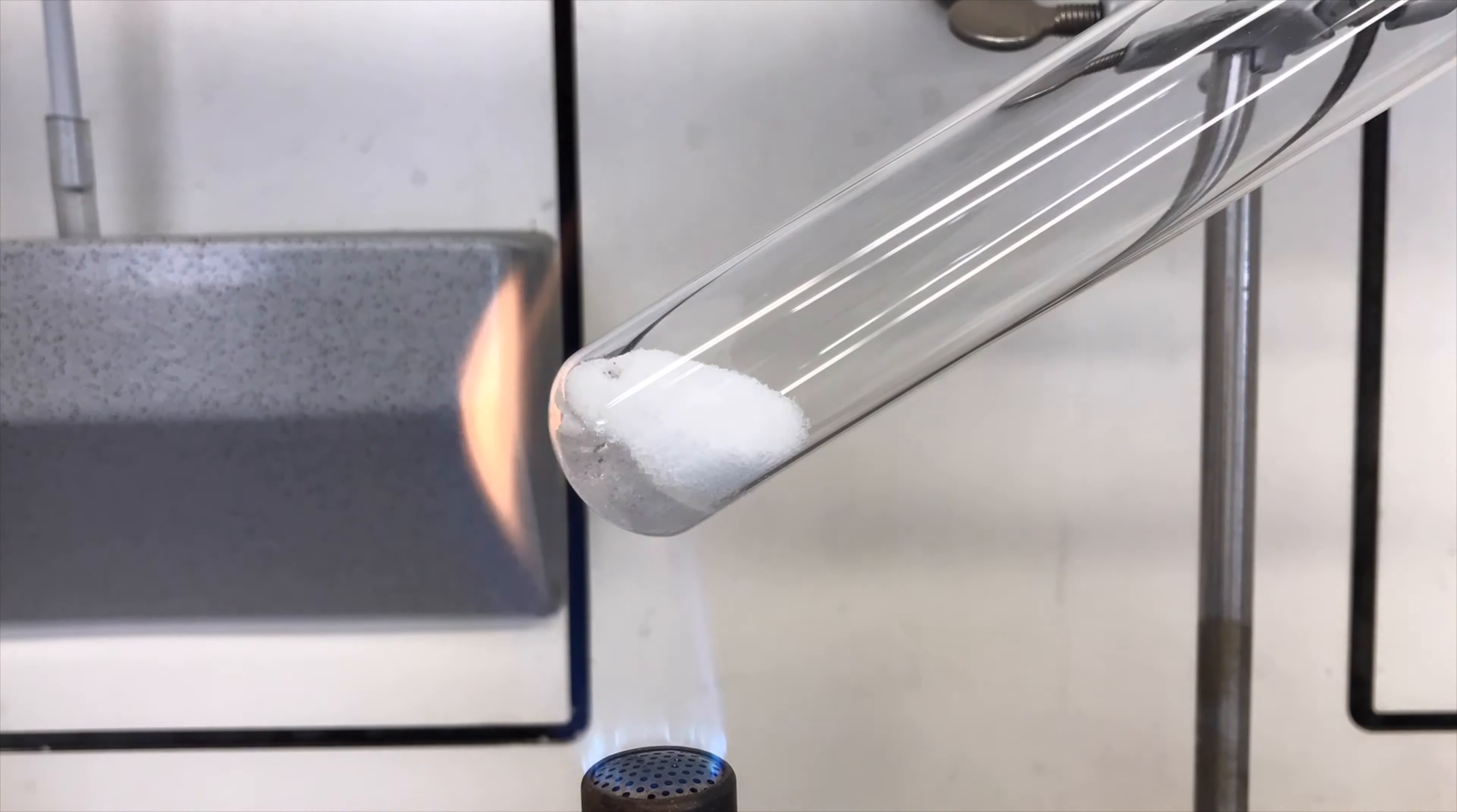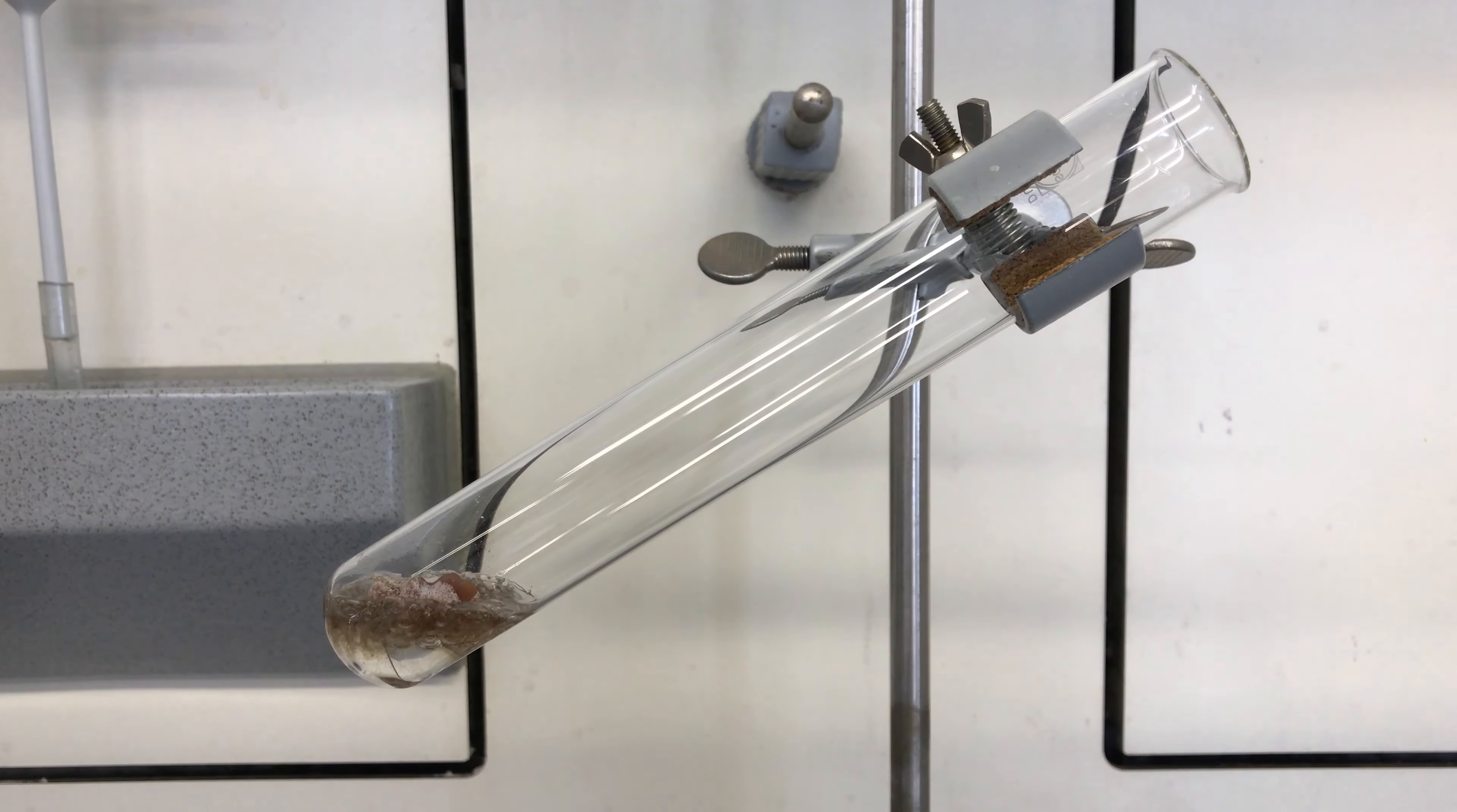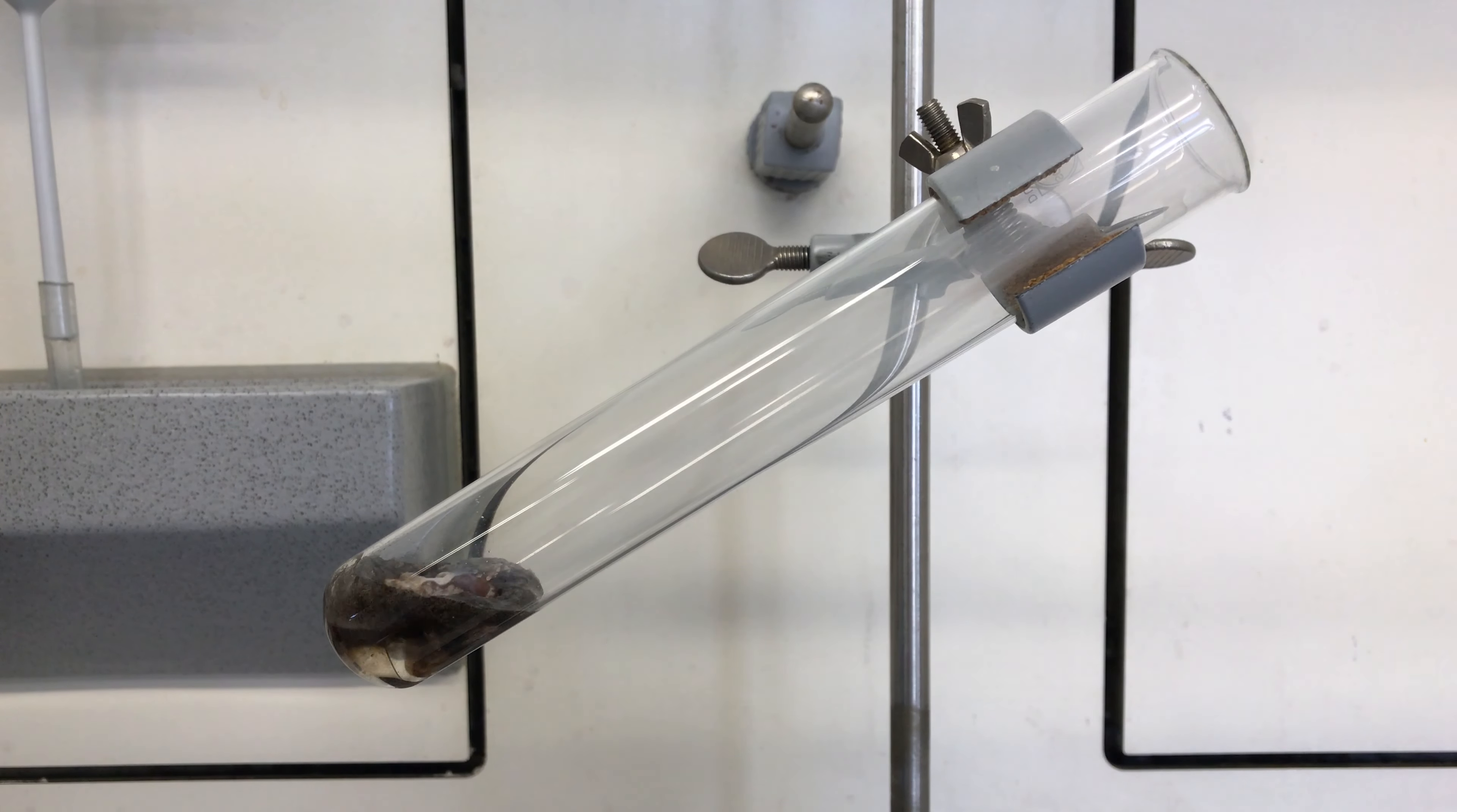We learned from our mistakes and this time chose to use a bigger test tube. We dropped it in and it didn't produce a flame but only a lot of carbon. Well, let's just heat it up.